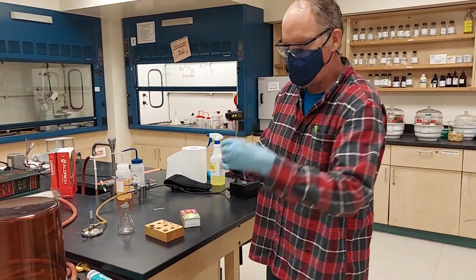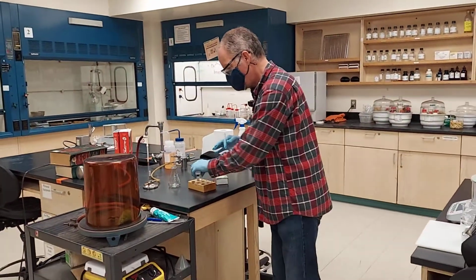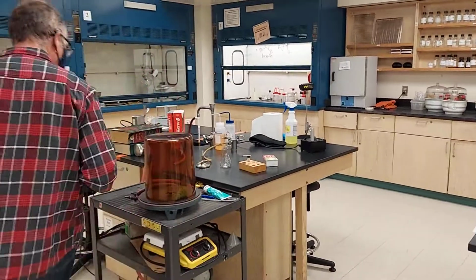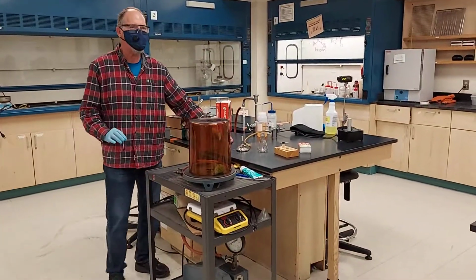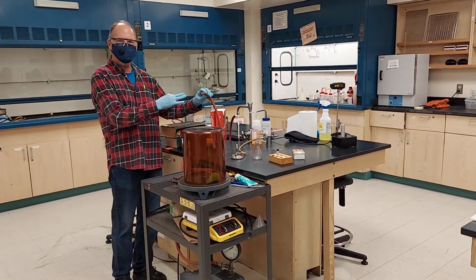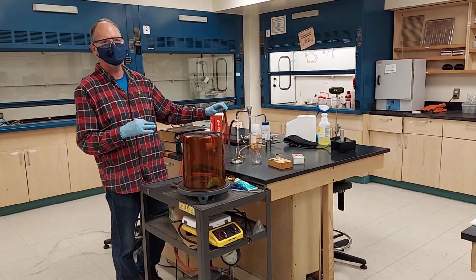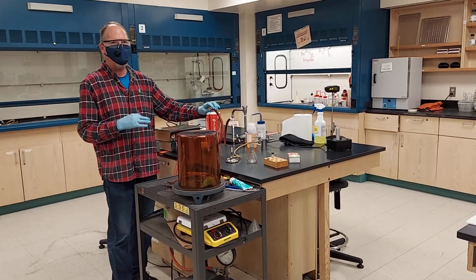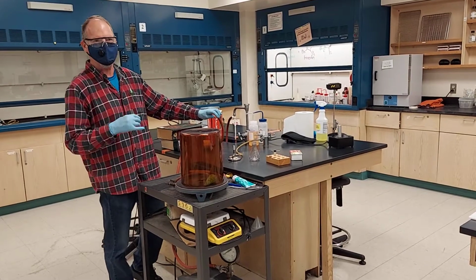That's why we have this machine here. It's a vacuum pump. We turn on our vacuum pump. Always turn on a pump when the hose is open to the room, and turn off a pump when the hose is also open to the room. That way air doesn't get forced through the exhaust system, kicking oil out of the machine.